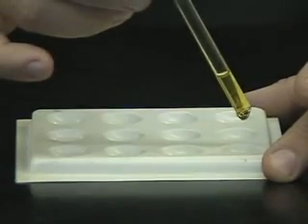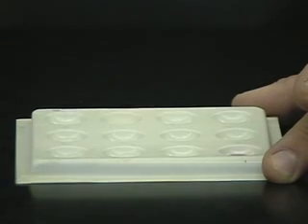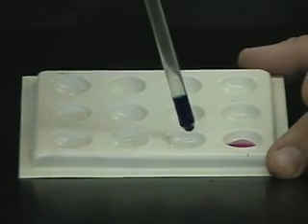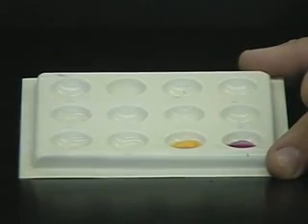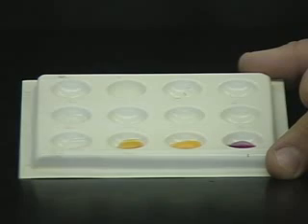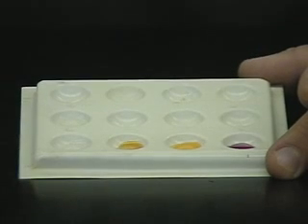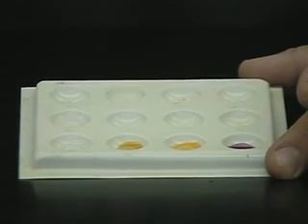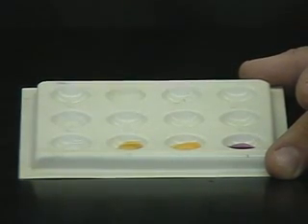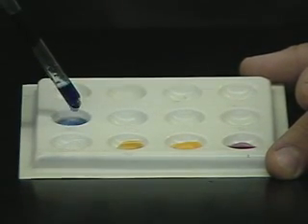Indicator 1 with HCl — notice it's a pink color. Indicator 2 in the acid shows yellow. Indicator 3 in the acid shows yellow. Indicator 4 in the acid shows clear. And the last indicator in the acid shows a bright blue color.